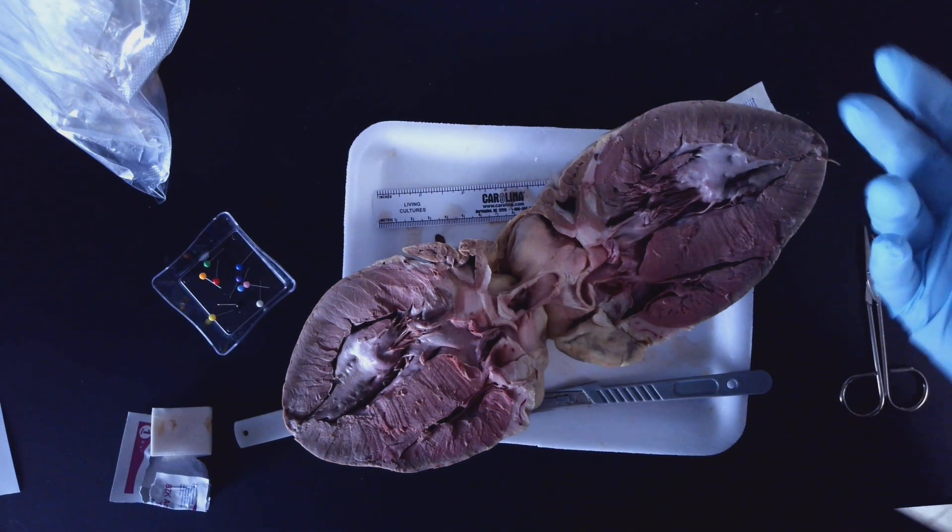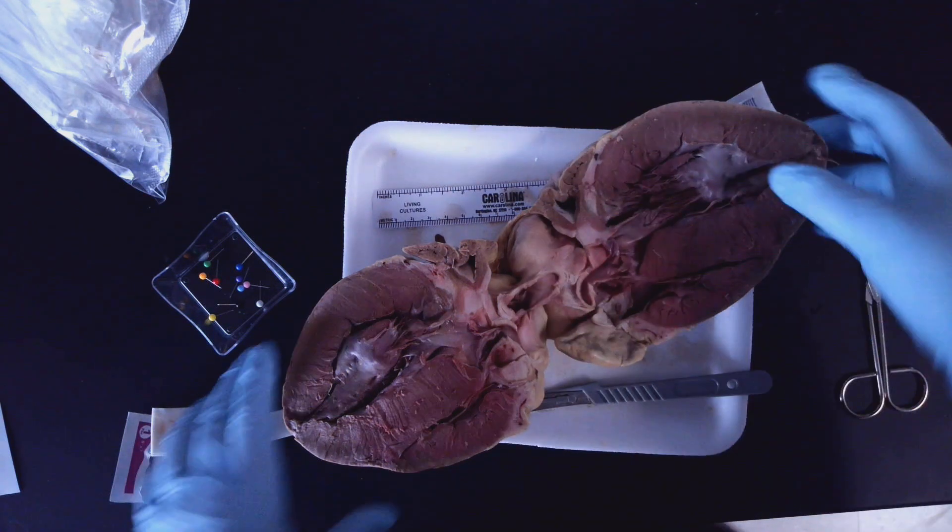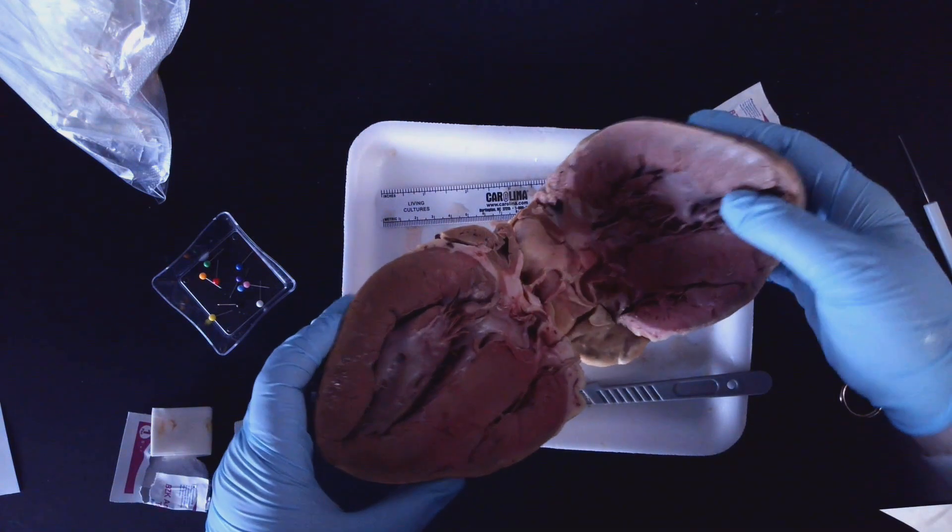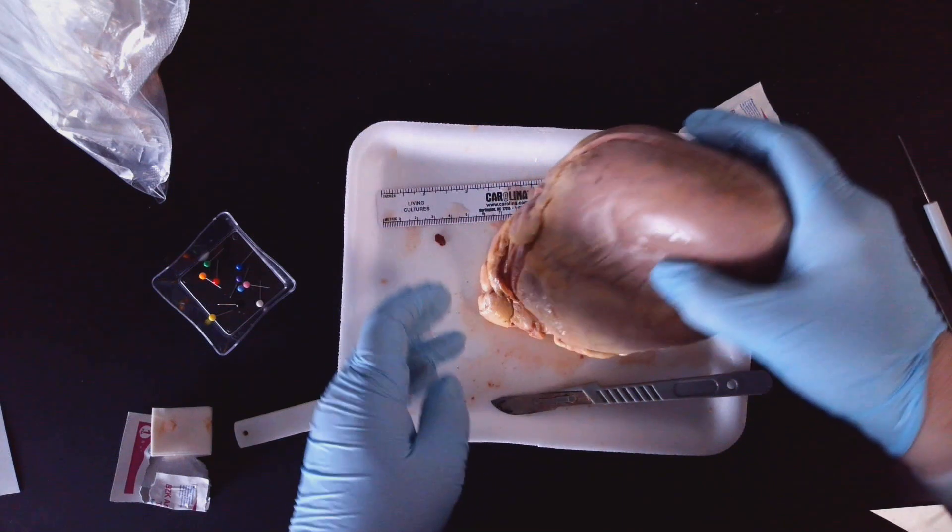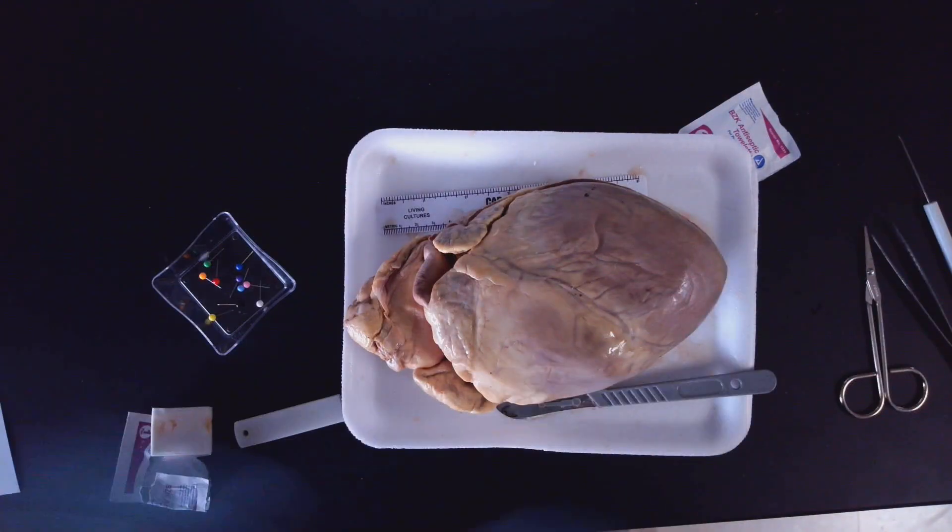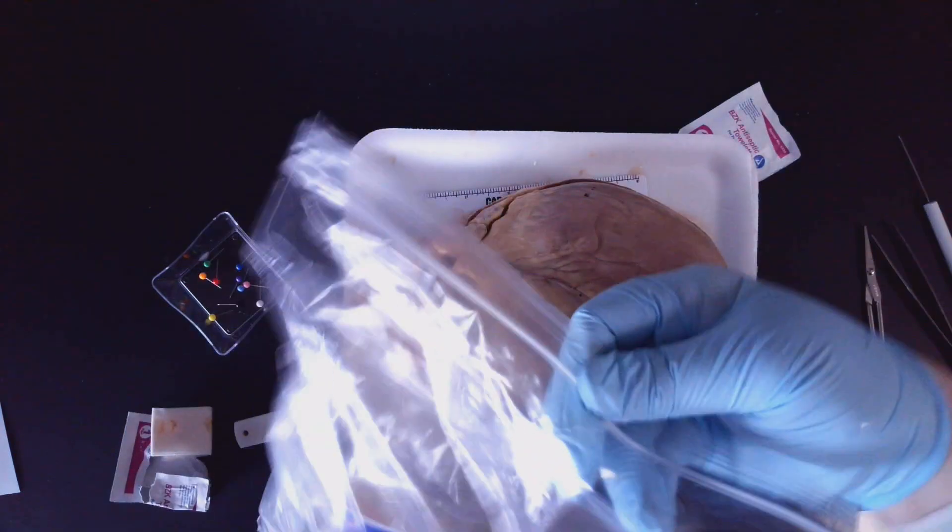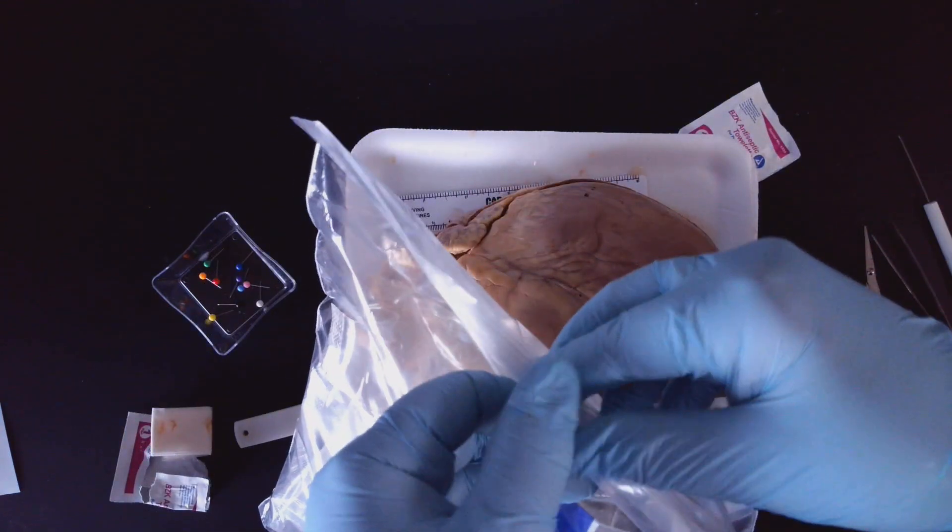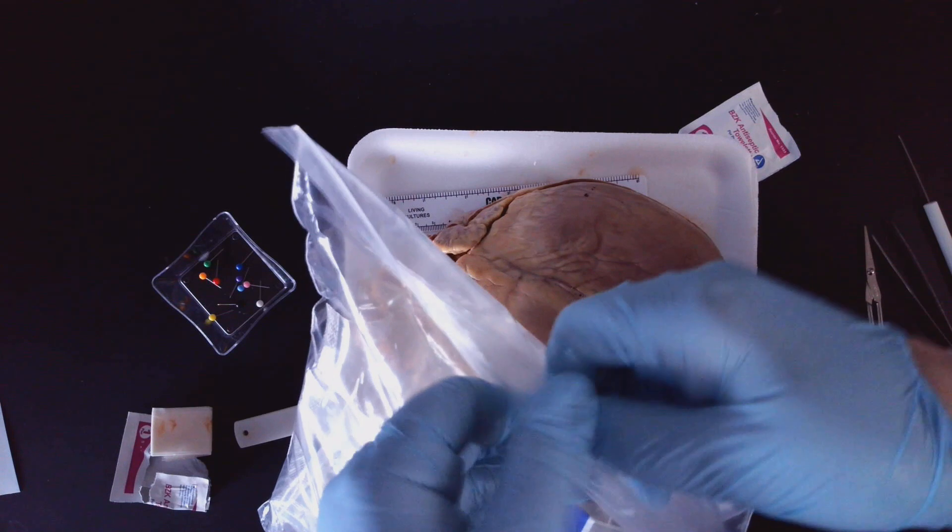All right, so let's talk about cleanup. I'm going to take this heart, close it up. Remember this bag that was closed up? I'm going to open it back up.